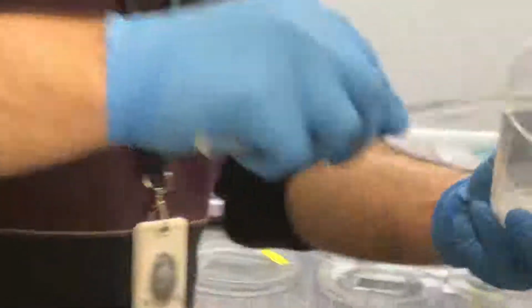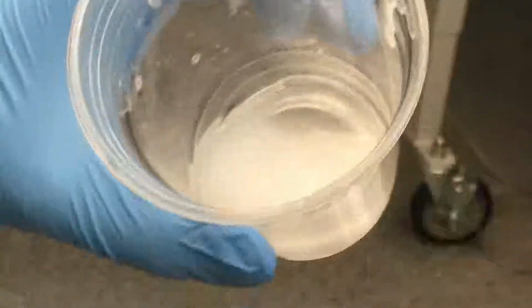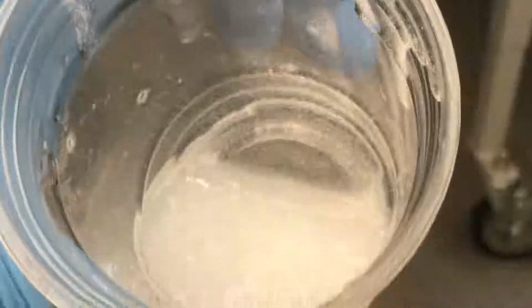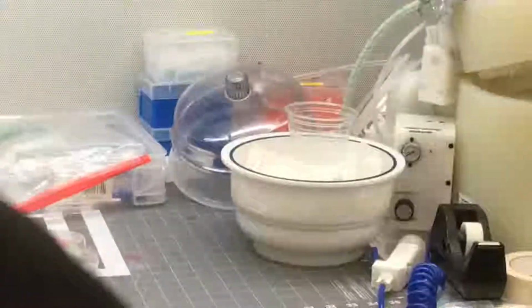Okay. Now you can see the difference of the color. It is completely white, opaque. And when you look from this side, inside, you can see the liquid contains bubbles, entrapped air. The physics law involved here is the surface tension between the gas and liquid. So for this reason, to remove all the bubbles, we use the vacuum.